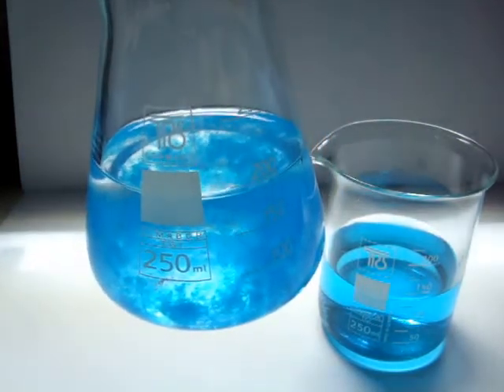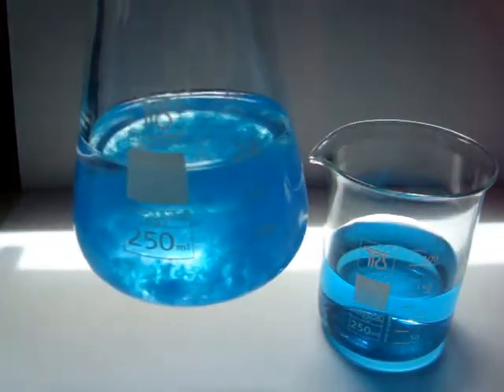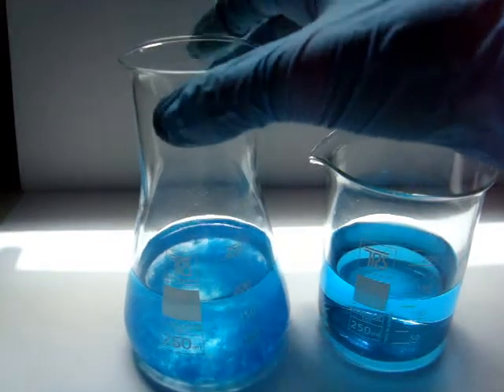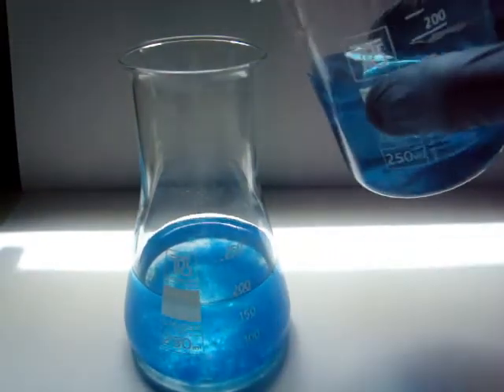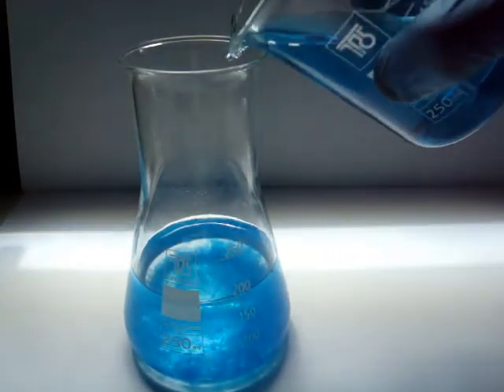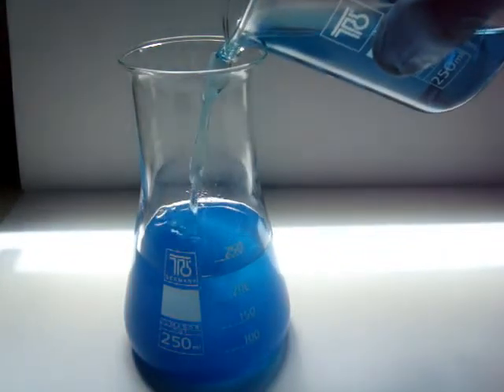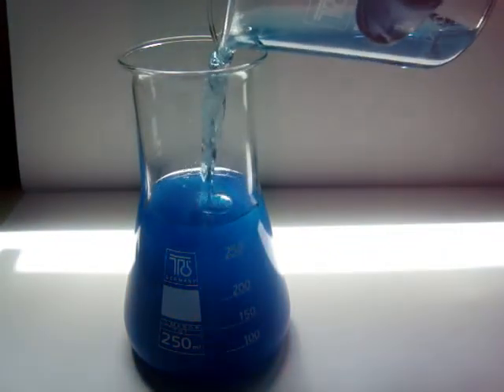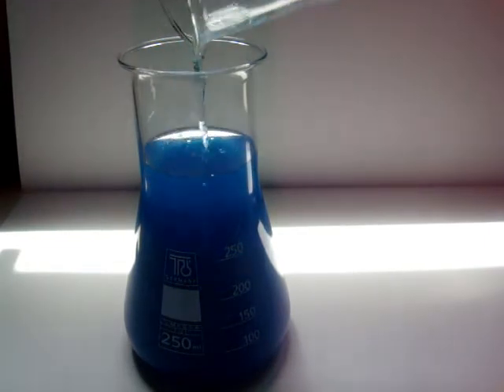It is a pale blue color. As you can see, it is a pale blue gelatinous solid. It is used especially in organic chemistry and also as a fungicide.